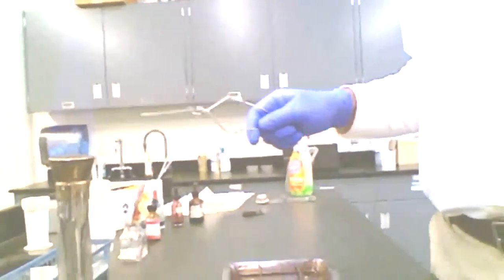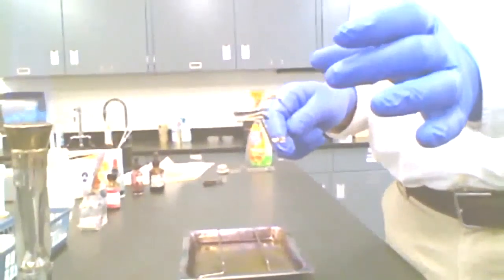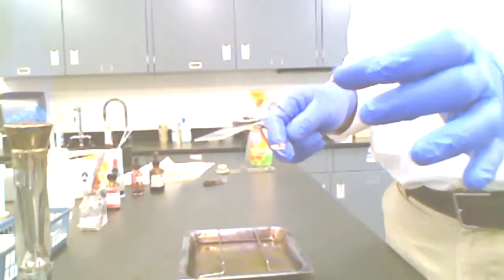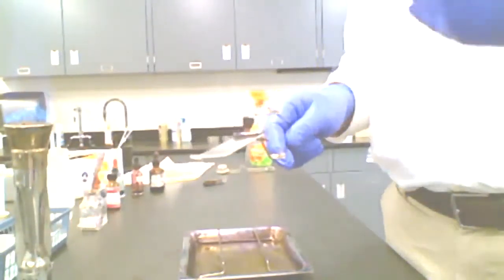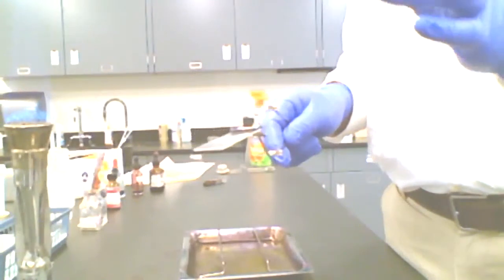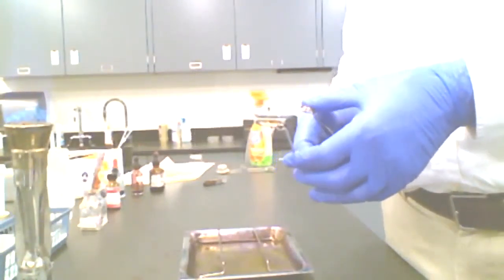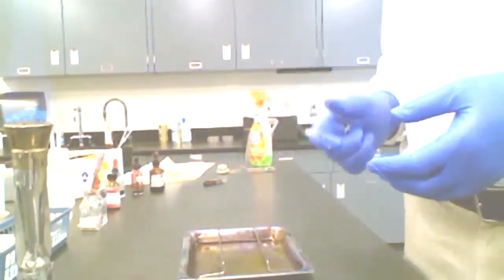What I've done is I've actually made that smear more or less baked onto that slide. I've not done this to kill organisms. That's not enough heat to do that. If I heated it to that extent, I probably would shatter the slide. But instead what I've done is I've made that smear more or less fast to the glass so that it's not going to come off when I apply my liquids, my stain reagents. I've got it heat fixed.